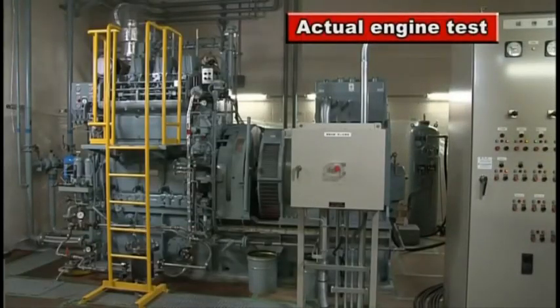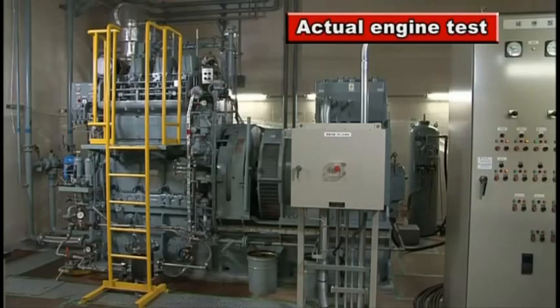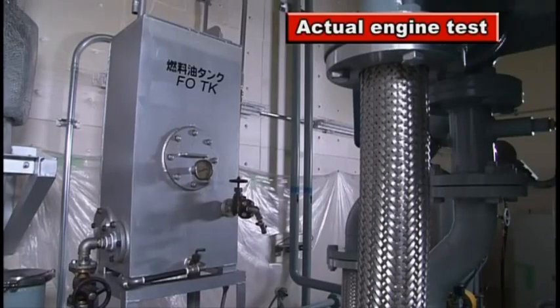Actual engines are also used to conduct combustion tests under real-world conditions.